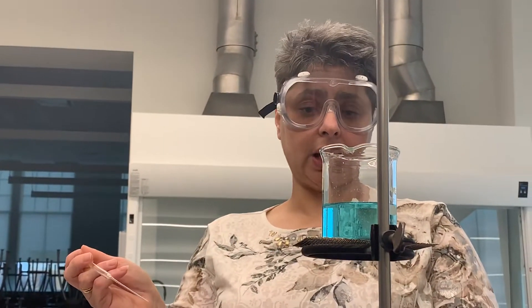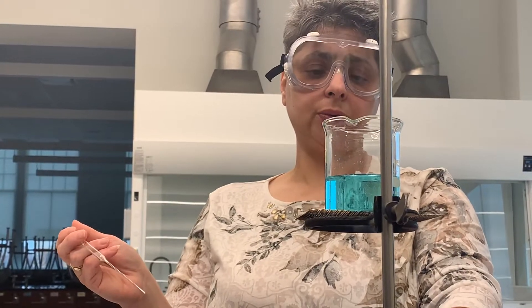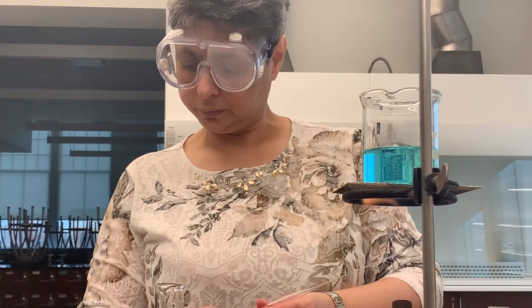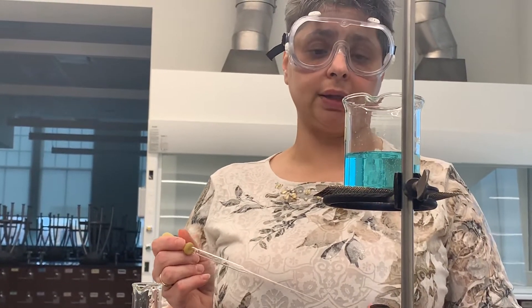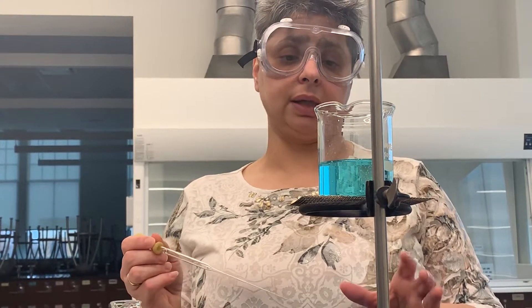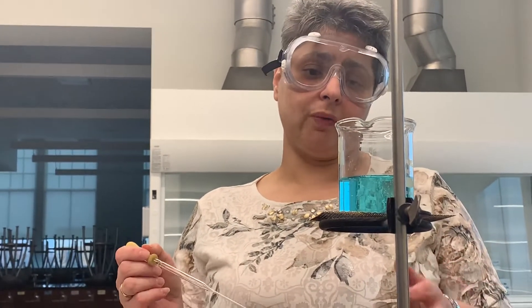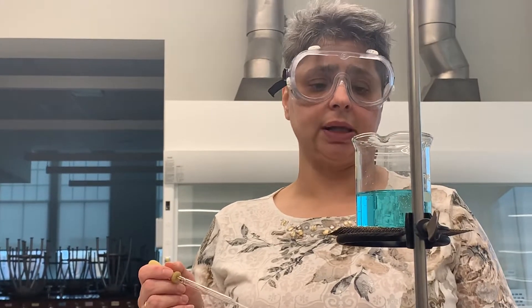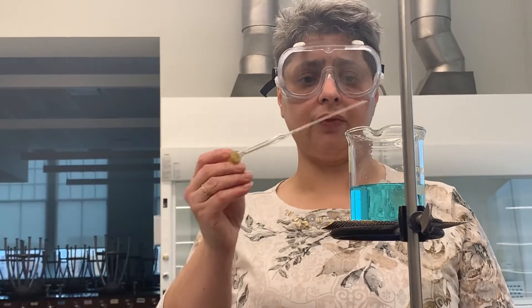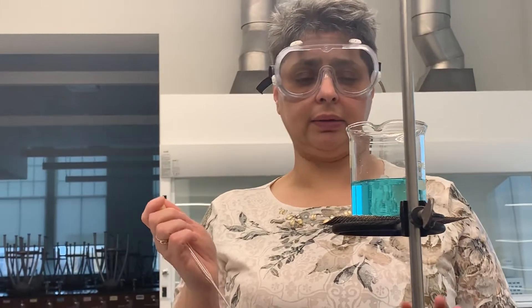My solution is now fairly hot and just about to start boiling. You'll notice I'm not using the watch glass recommended in your procedure — I'm doing that to save time. A watch glass would be advisable in case you're worried the solution might over-boil, covering the rim of the beaker to prevent any particles of barium sulfate from escaping. I'm fairly confident I can manage without, but I would still suggest it if you were doing this yourself.